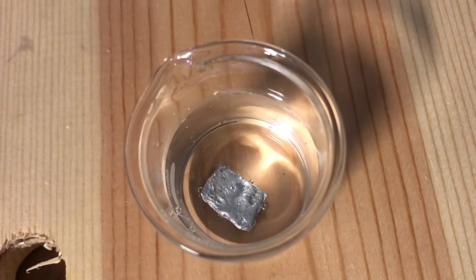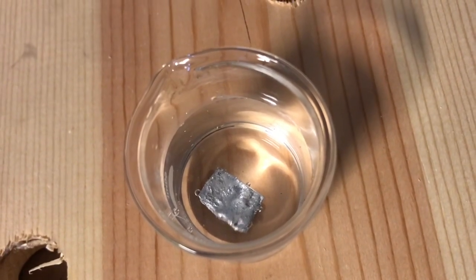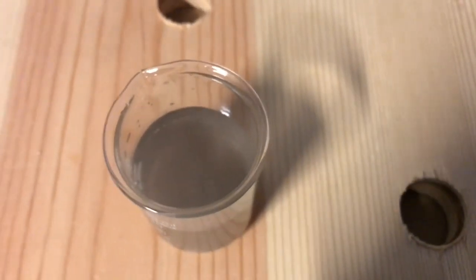You can see little bubbles of hydrogen coming off it. Now it's going a bit faster. You can see more bubbles.